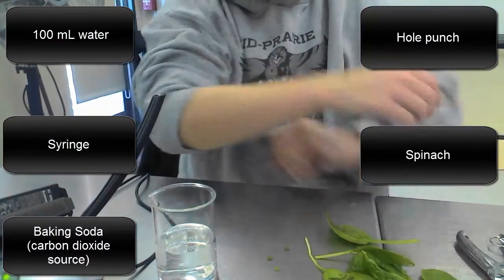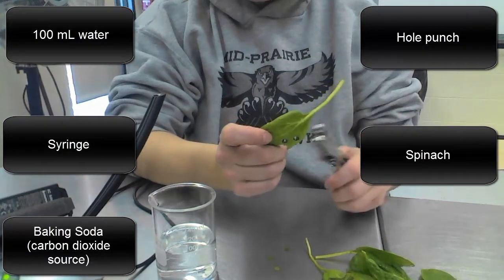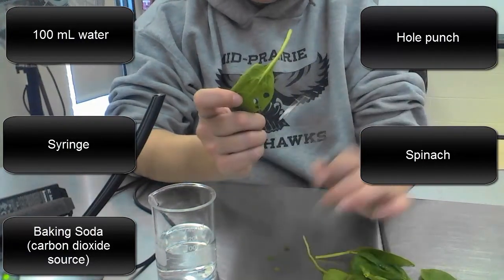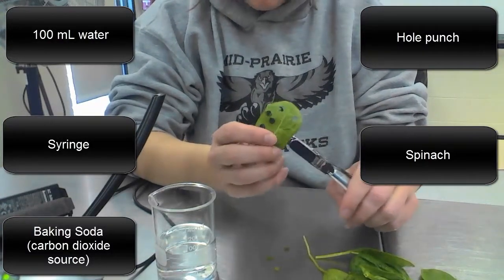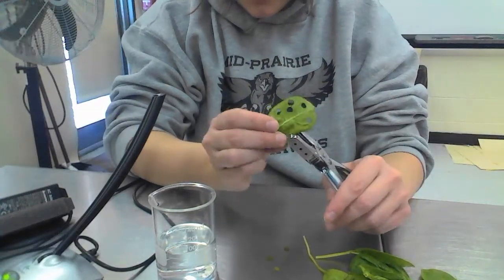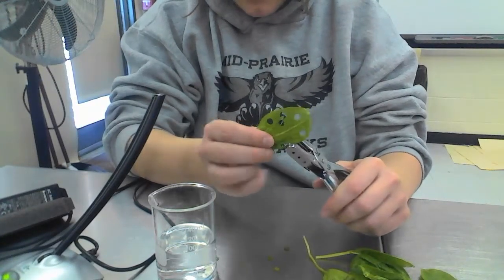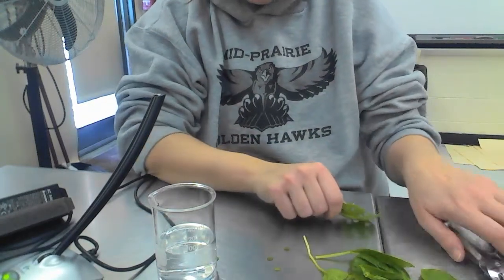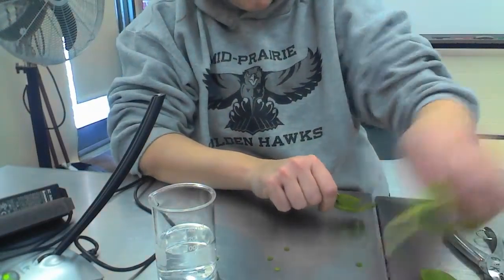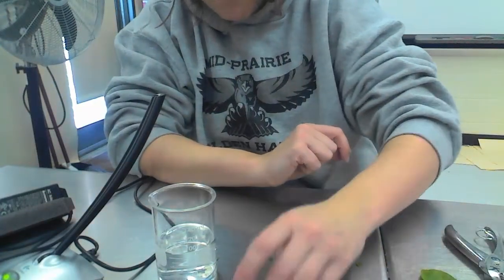All right, so to get started, you're going to need to punch some holes into your spinach so we can have these little discs, which are called chads. When you want to create a hole punch, you want to make sure that you're punching holes of the spinach in between the veins, or the little lines on the leaf. You'll want to make sure you can easily punch out like 15, 20 of them, but you need to have at least 5 of them.